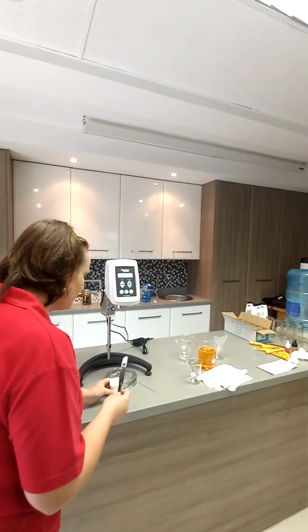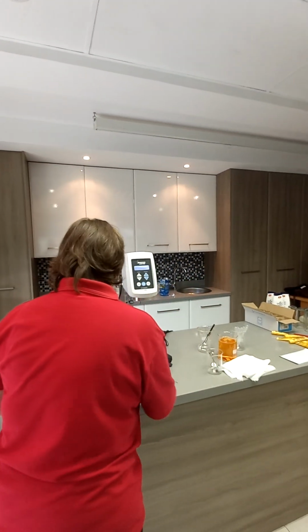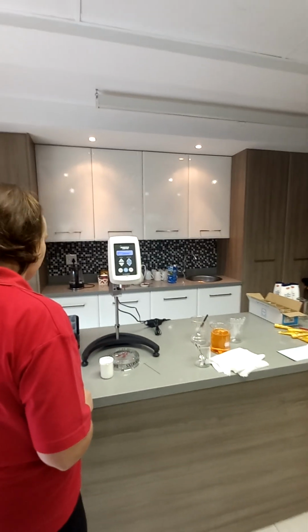Okay. So I try and have it up there. Now I need something hard.